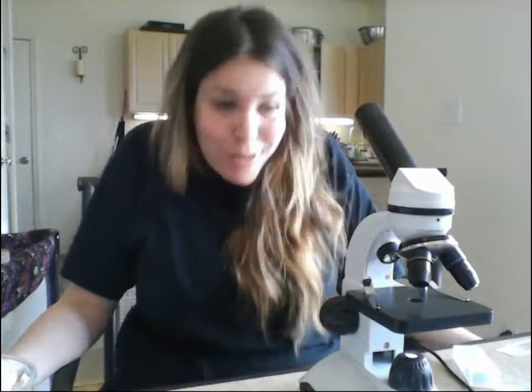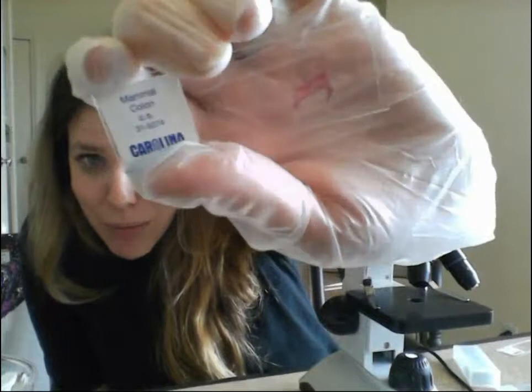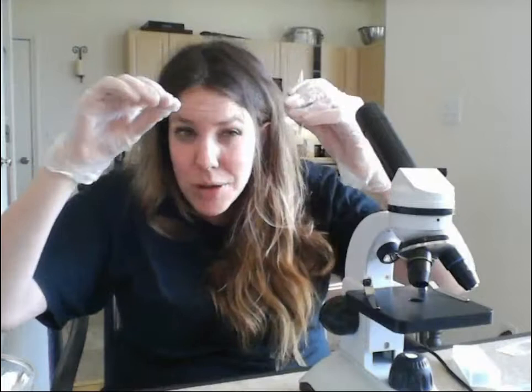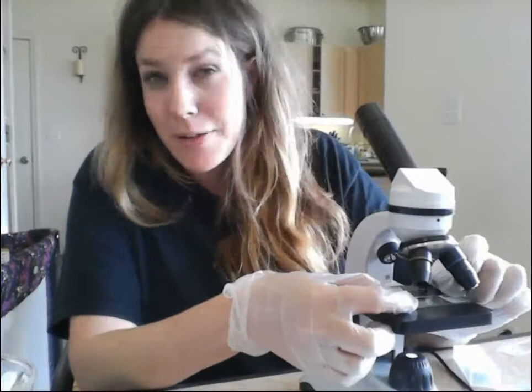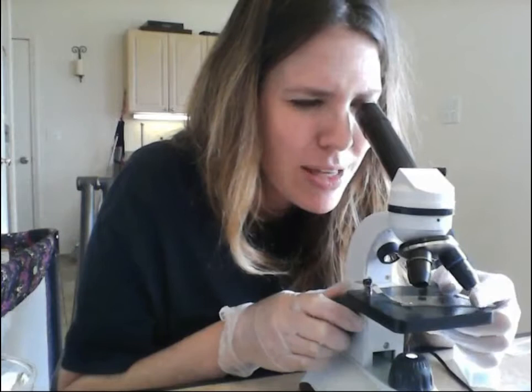Now you're ready for the advanced course. Let's see if you can magnify your mammal colon — the epithelium, the cell lining of the large intestine of some mammal. The epithelial layer consists of some outer cells and a bunch of bubbly-looking things called goblet cells, which produce the mucus that lubricates the inside of the large intestine. Underneath that you'll see layers of connective tissue with blood vessels and more. If you are an expert microscoper, you'll prove it by focusing your mammal colon, because you'll really only see the structures at the highest magnification — so don't forget to play with your iris diaphragm.